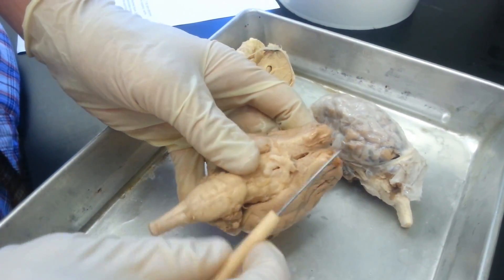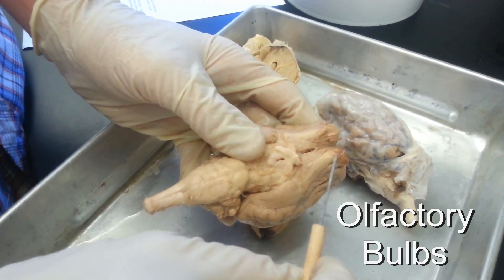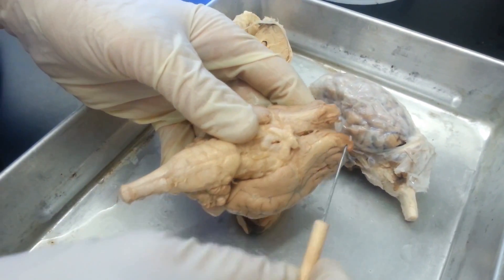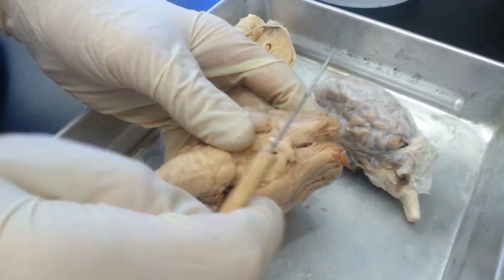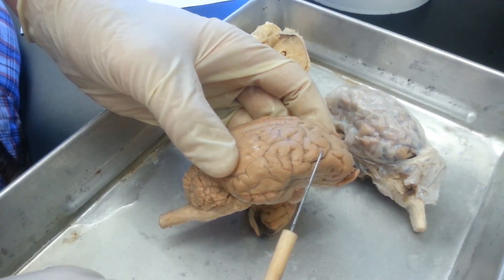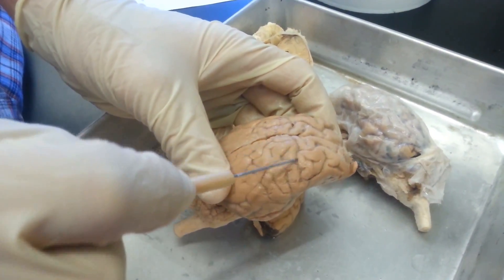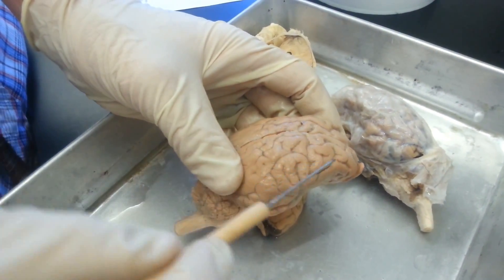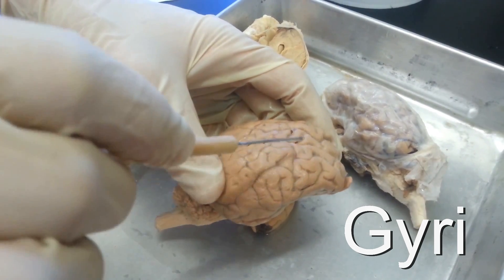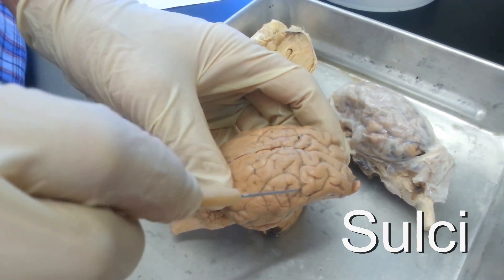You have two lobes which control the olfactory region — these are the olfactory bulbs. And then on the cerebrum you have folds and valleys. The folds, the raised portions, are the gyri, and the wrinkles are the sulci.